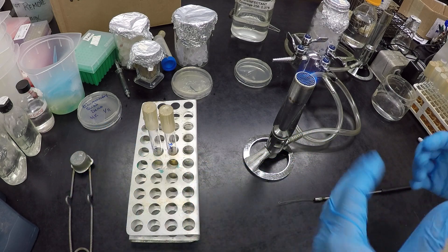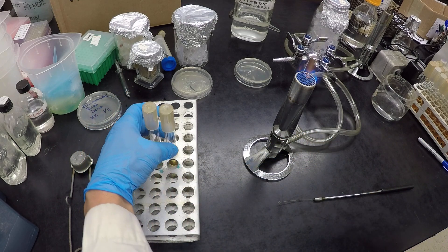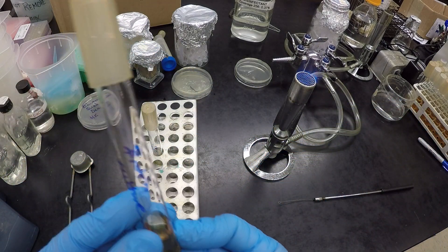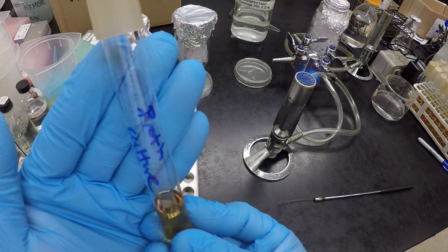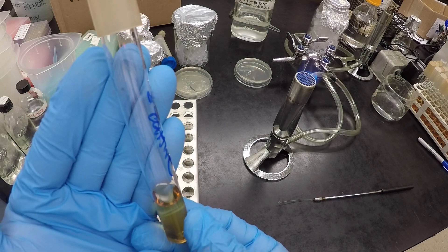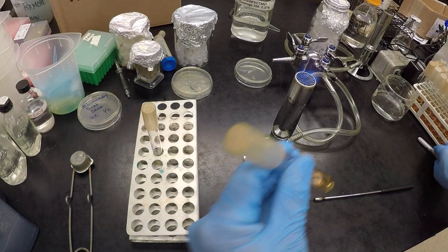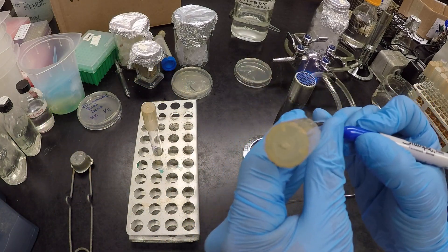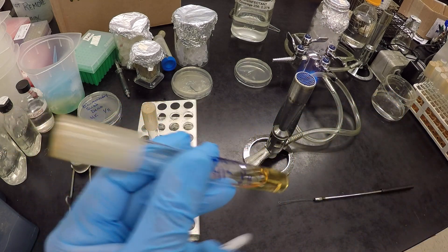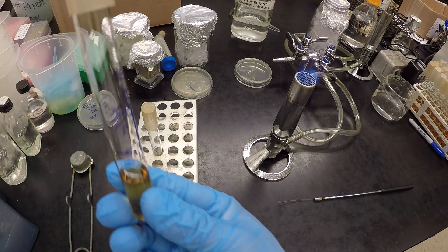So let's start off with a broth inoculation. This is my sample broth culture. Notice where it's been labeled. So that's our broth culture. I label it. You should also put your initials on here. We'll add our initials, the date, lab section if necessary, whatever else you need.